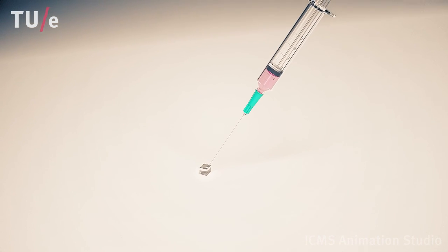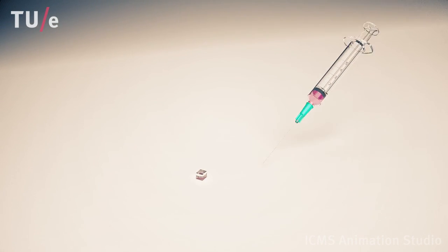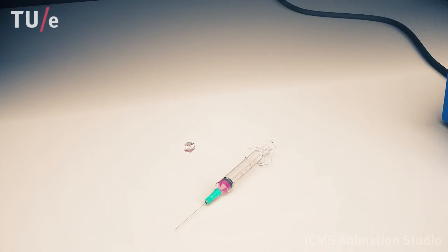A liquid is injected into the microfluidic channel, and the device is placed on top of a rotating magnet apparatus.